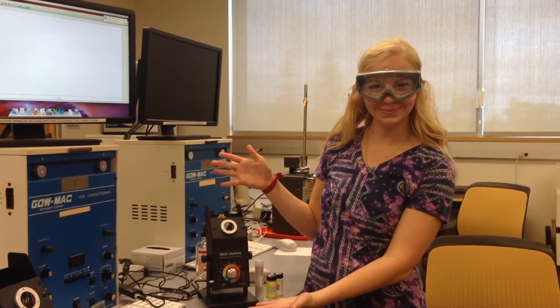Hi, my name is Christy Ann and I'm a biochemistry major from the class of 2016. Today I'll be demonstrating how to operate a meltemp. Meltemps are a tool that allows us to measure the melting temperature of a substance, usually organic compounds.